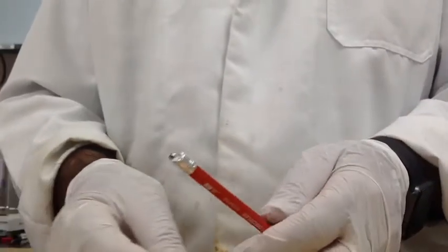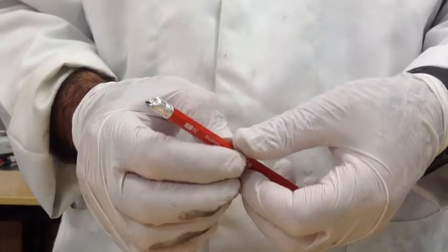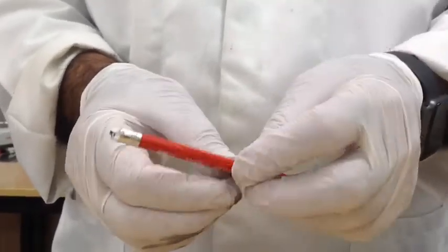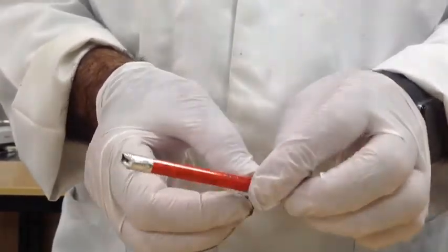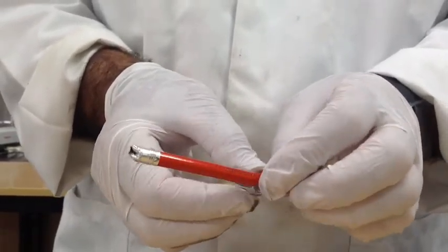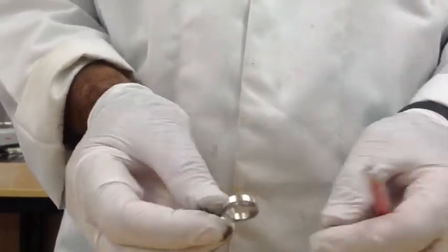One way that is usually practiced is to use a pencil and wrap the ribbon around the pencil softly, so it forms something like a spring. We'd like to see that a little bit of air can still travel around the spring, because after all we want the combustion completed.